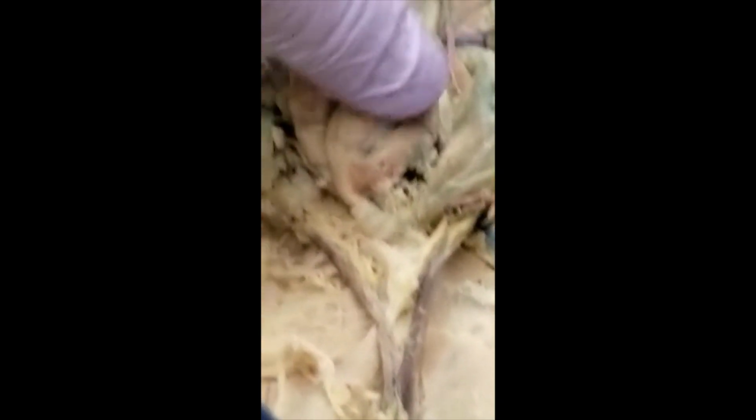Then that's the renal, supplying the kidney. Okay, renal. After renal, you find this branch. This is testicular. Testicular goes all the way down through here, through the spermatic cord, and gets into the testes. So it's called testicular. On this side, this is the other side, testicular.